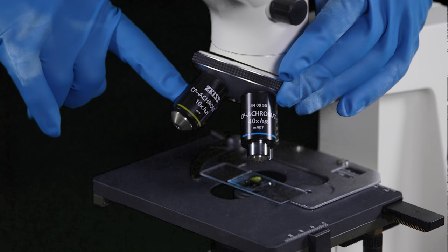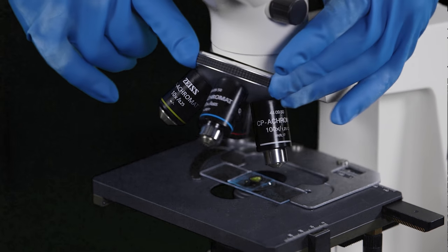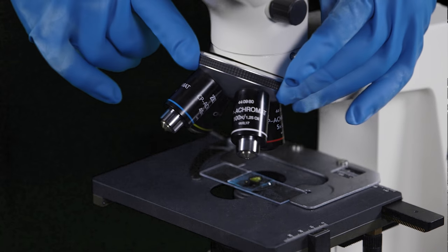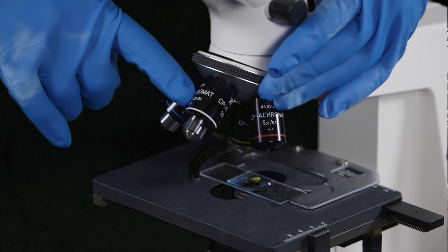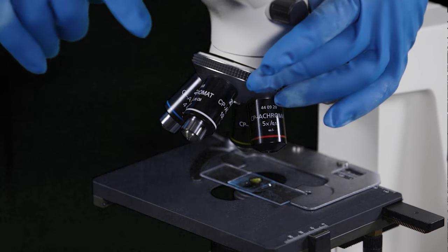Here's the 10x objective, here's a 40x objective, and here's a 100x objective.